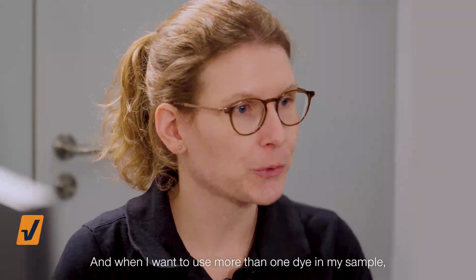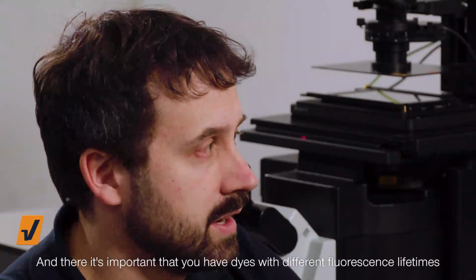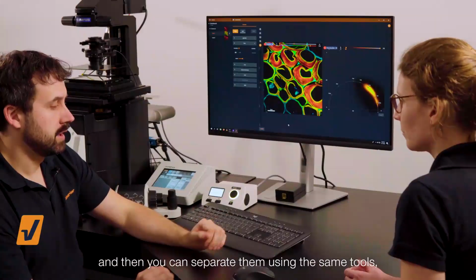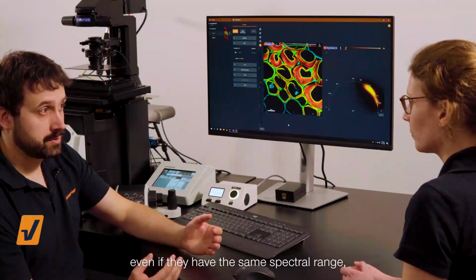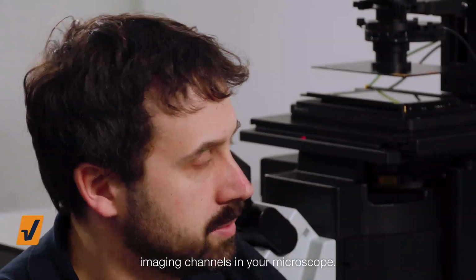And when I want to use more than one dye in my sample, can I separate it as well? Yes, of course. And there it's important that you have dyes with different fluorescent lifetimes. And then you can separate them using the same tools, even if they have the same spectral range, which means you get basically some bonus imaging channels in your microscope.